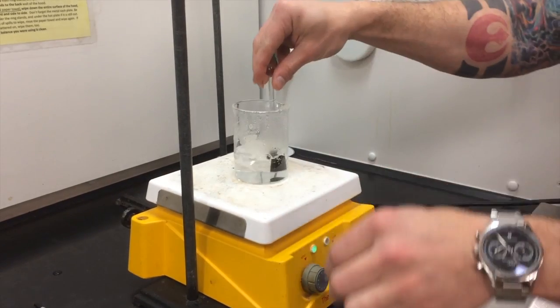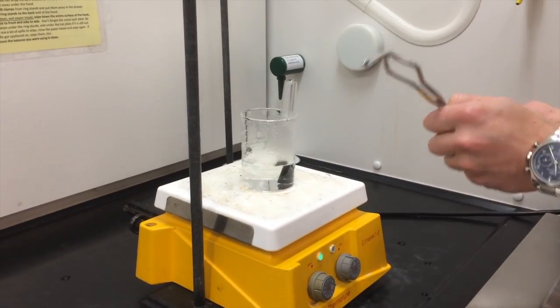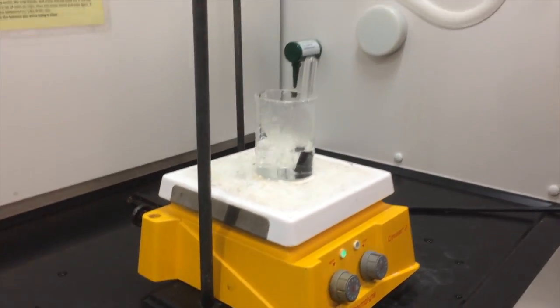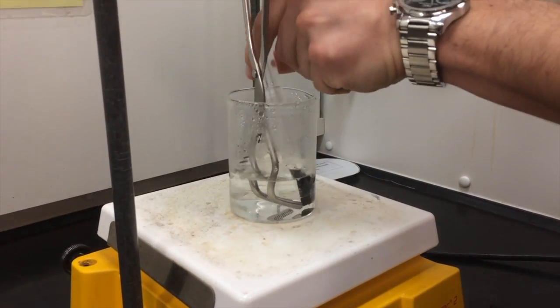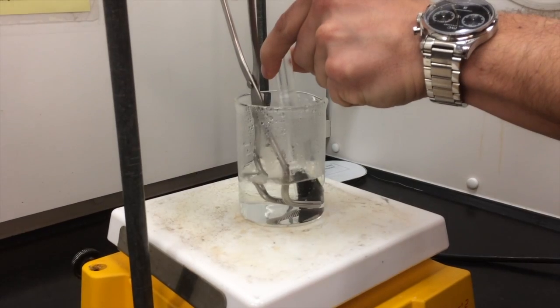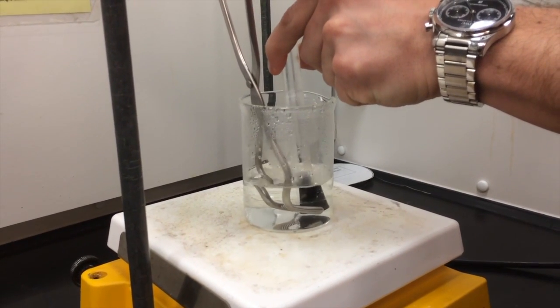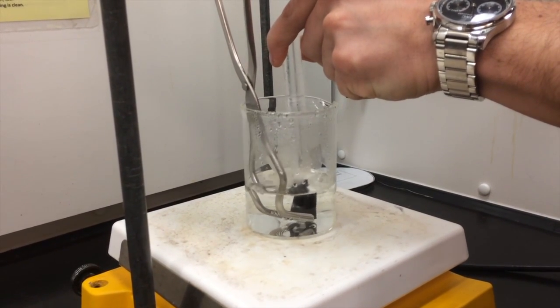Moving on, we'll look at the bubbles in boiling water. Reheat the water until it boils and fill a test tube with water with a stopper in it. Then invert the test tube in the beaker and carefully remove the stopper so the tube rests on the bottom of the beaker. Be sure not to remove the test tube from the water during this process.